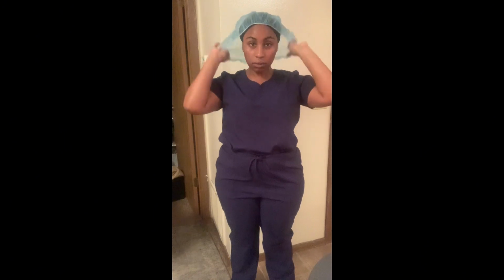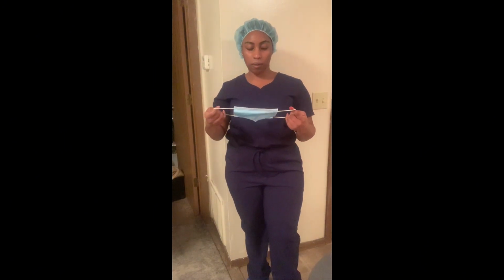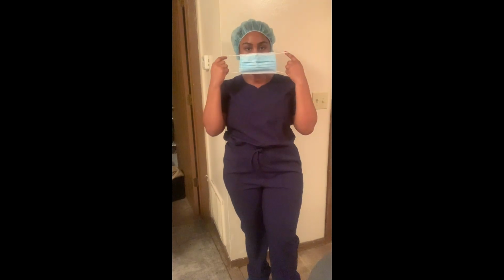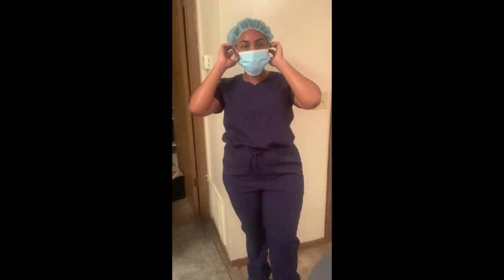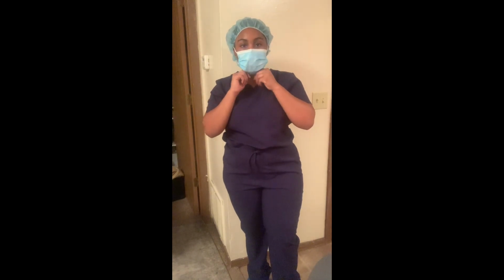Okay, I'm gonna put this on. And I'm gonna put this on.